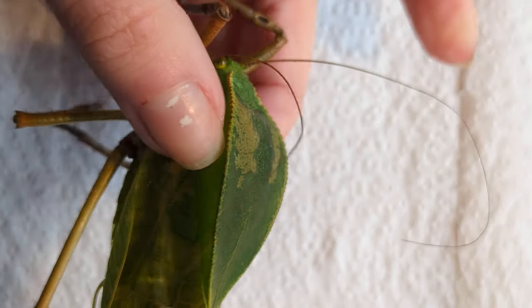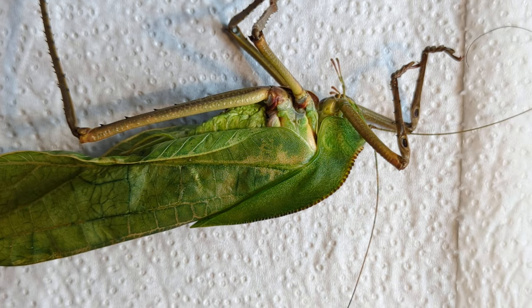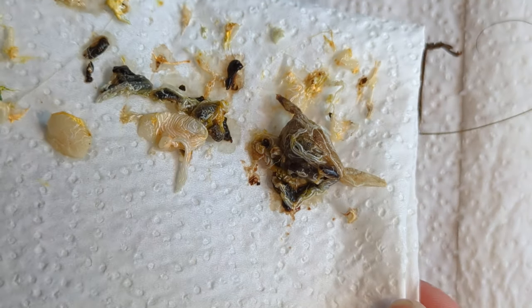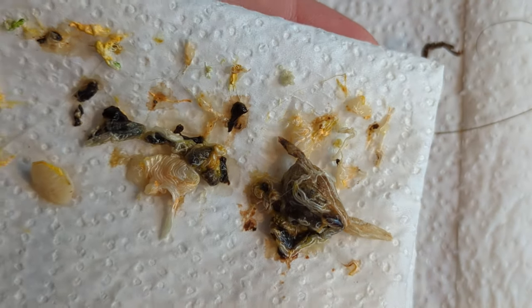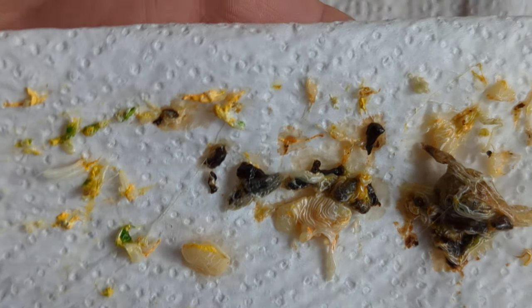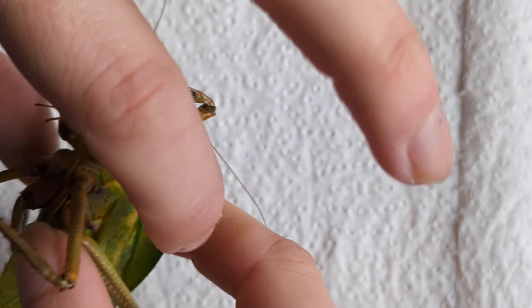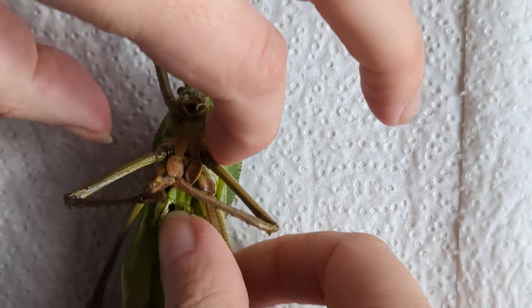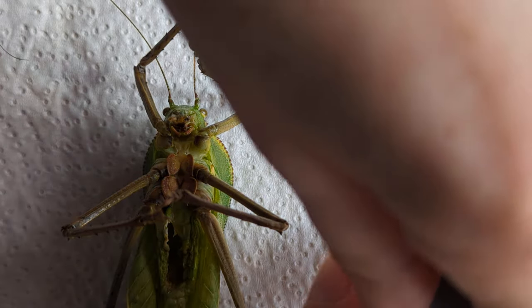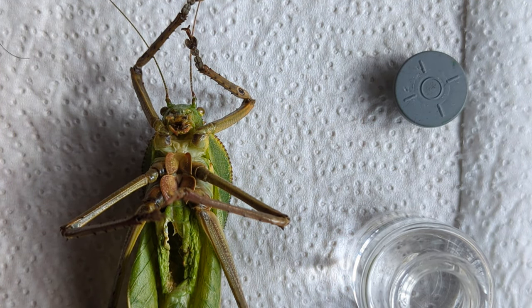So I'm happy with that. It wasn't as gooey as I thought. I'm going to show you the contents — I'll just take this light away because it's strobing. That is the contents. Done. Clean.